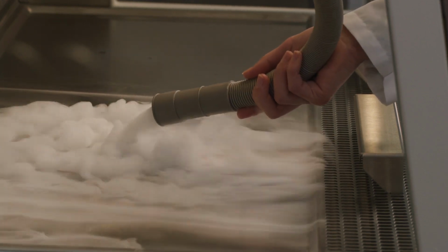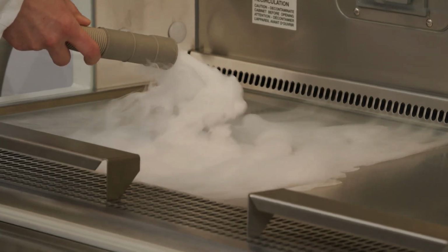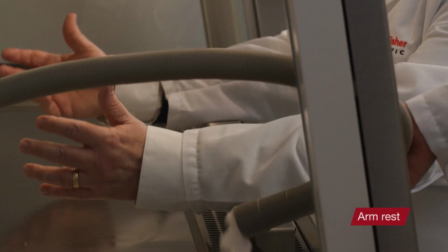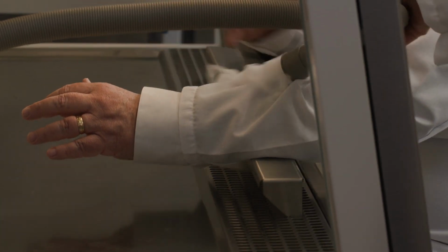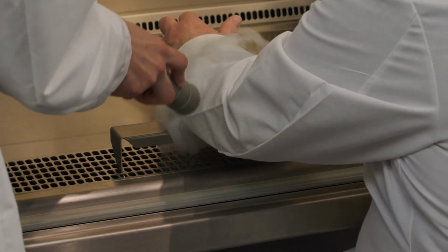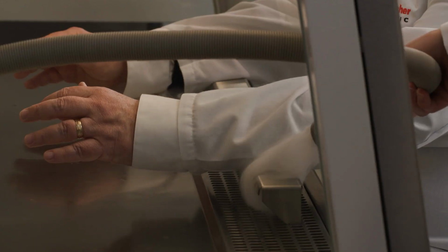So with the smoke, anything that you wanted to check out? Yeah, I thought the next thing that we should look at is the armrest, because often you're working in there and your arms are blocking the front grill, and I'm thinking, how does that work? So I have my arms on the armrest, so I'm positioned to work here. Now see how the smoke flows around my arm and then under the over-the-grill armrest to the grill. Yeah, you can see that there's no smoke that's getting to the work surface of the biological safety cabinet. It's all going down into the front grill.